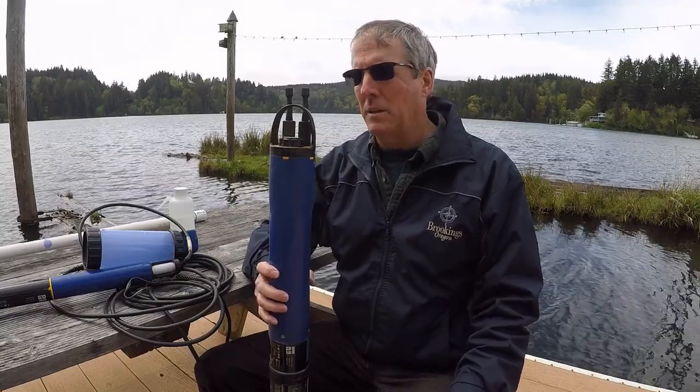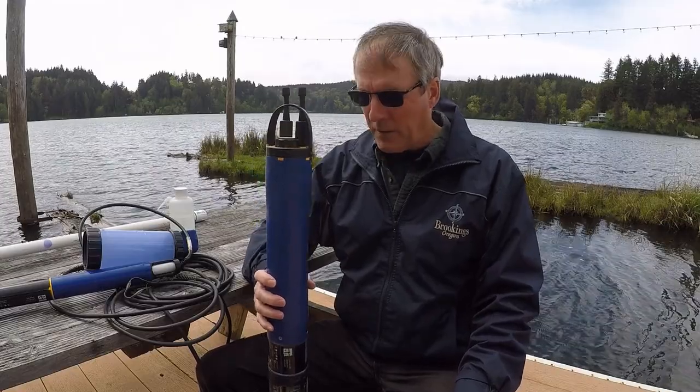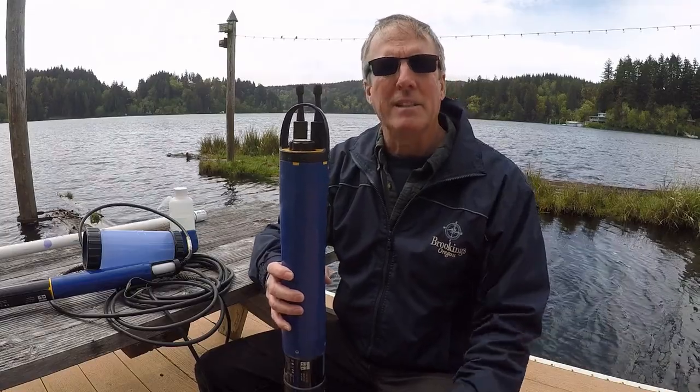So these are really important to be able to use, and hopefully on one of your jobs in the future, you'll have a chance to use one.